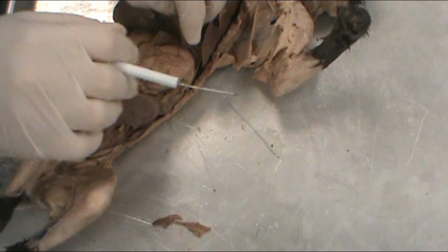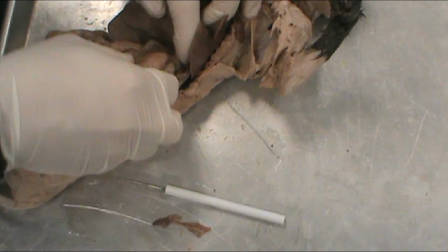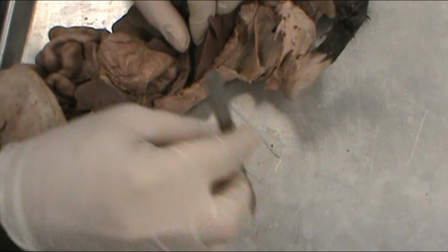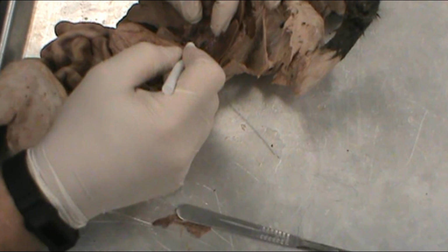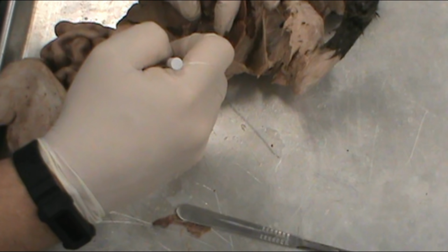Moving down into the body, we have the stomach. It would be this J-shaped organ right here, and right here as the tube that runs into the stomach would be the esophagus. And we can clean this up a little bit. I can trim some of this diaphragm away, and we make the esophagus a little easier to see. That would be this tube right here. So this big tube running down into the body, into the stomach. This would be the esophagus.